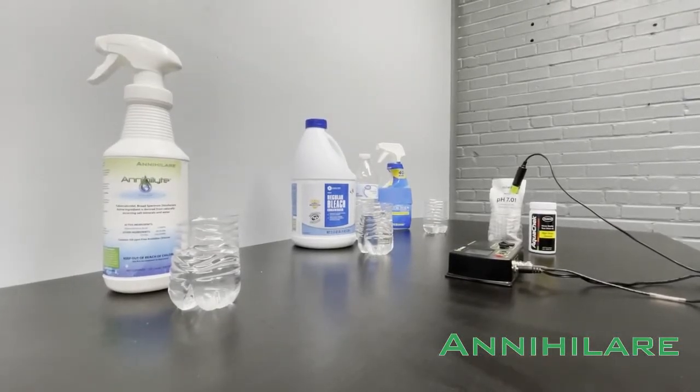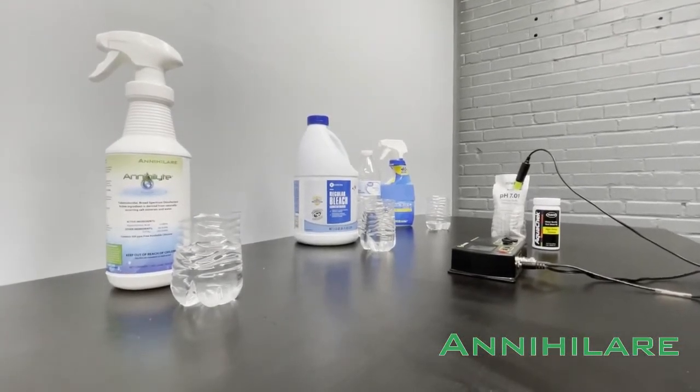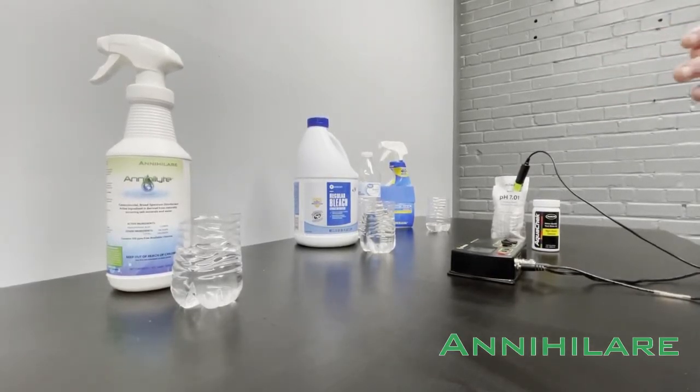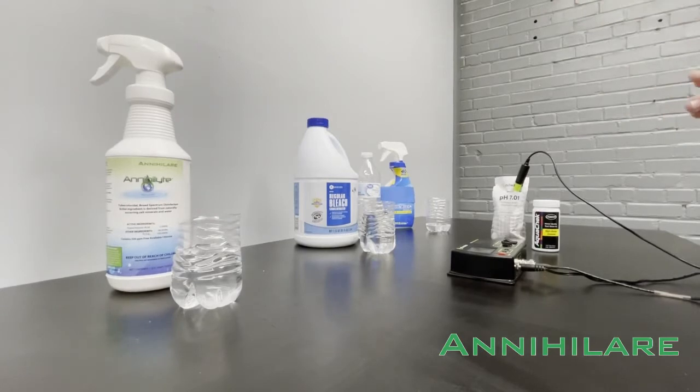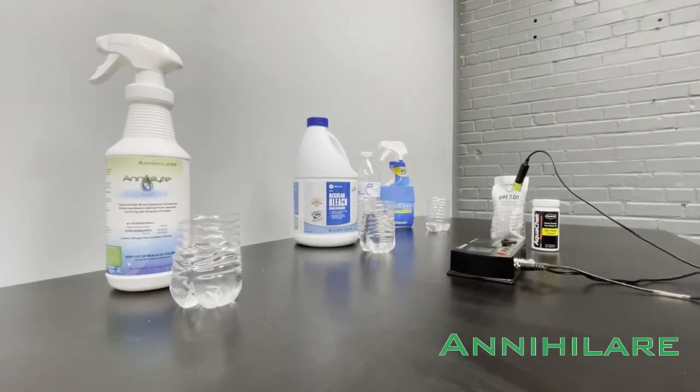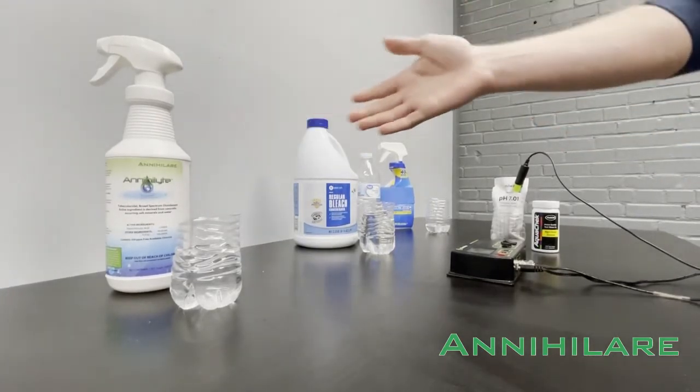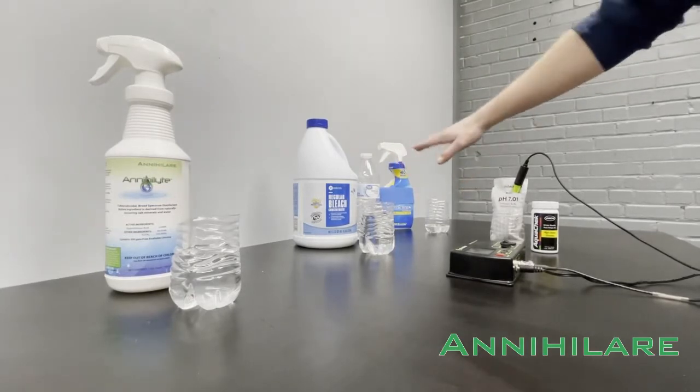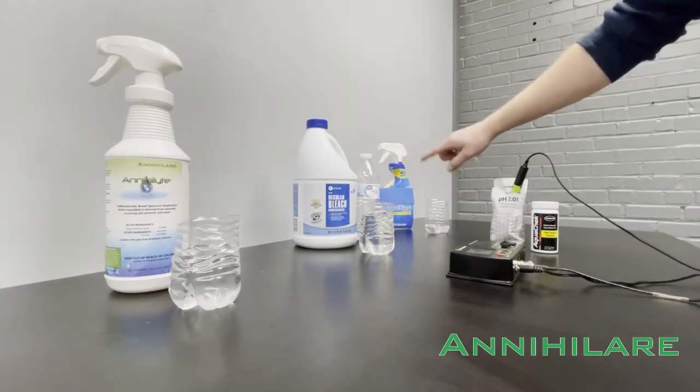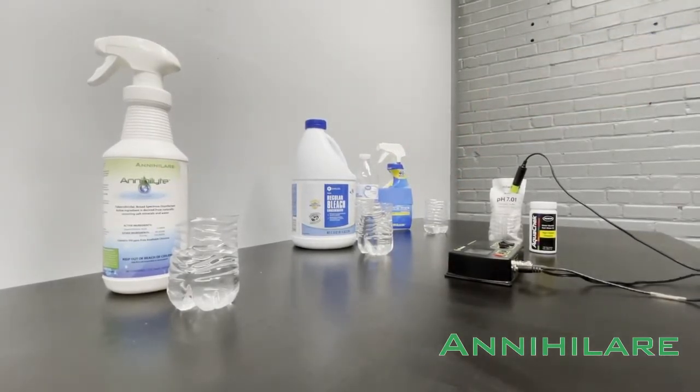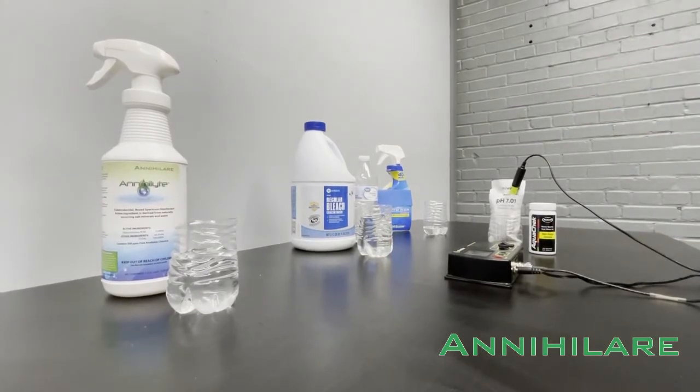Today we want to show in application some of the chemical differences between hypochlorous acid products and traditional diluted sodium hypochlorite bleach products. We're going to do that by having samples of each, and then later on we're going to show the difference between these cleaner and disinfectant all-in-one step products and some of the nuances there.